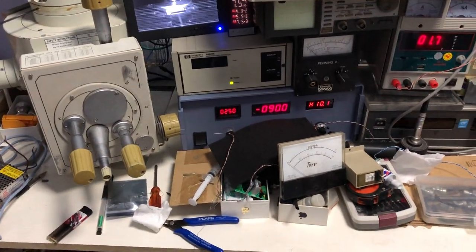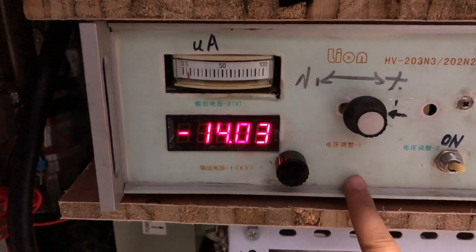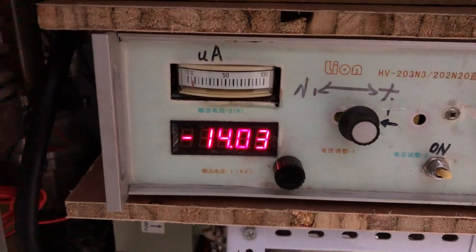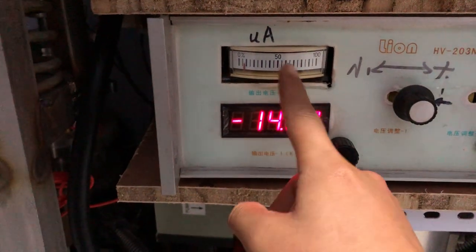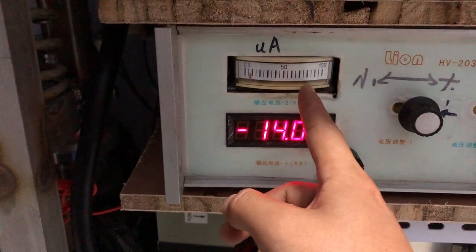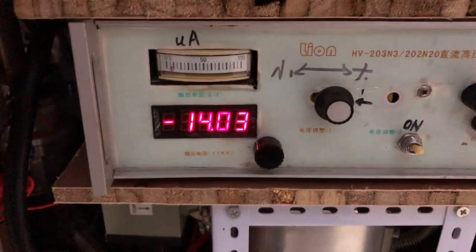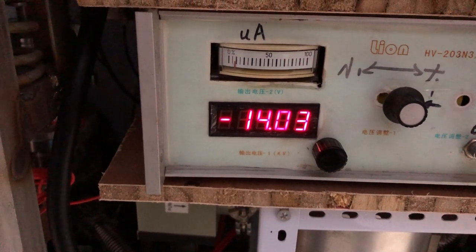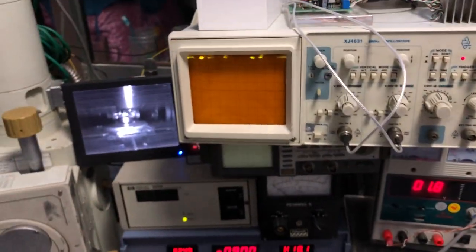After the gun alignment process, I will show you the progress that is here. Before we adjusted the gun alignment, the position of the column and the magnet, objective lens structure, we were using about 100 microamps to get a good enough secondary electron image. So now we are basically using about 10 microamps. With this little emission current, now we can see a quite clear image.